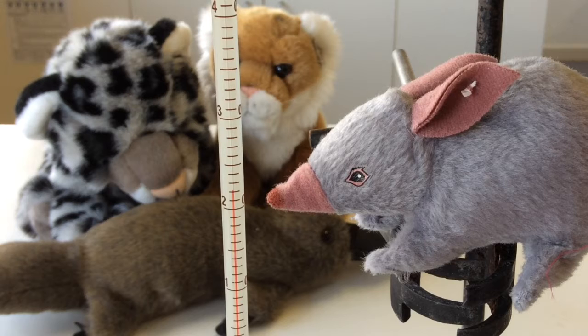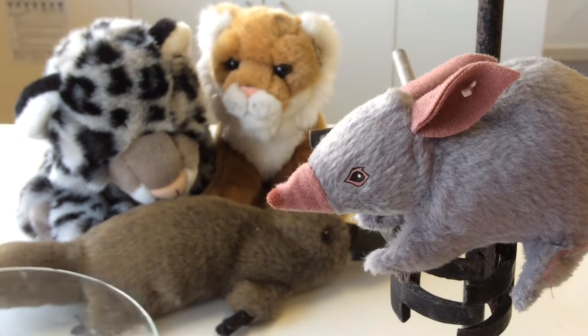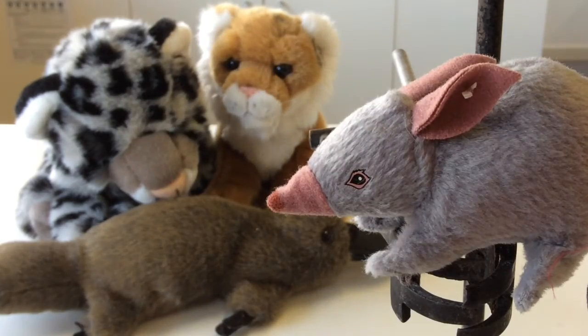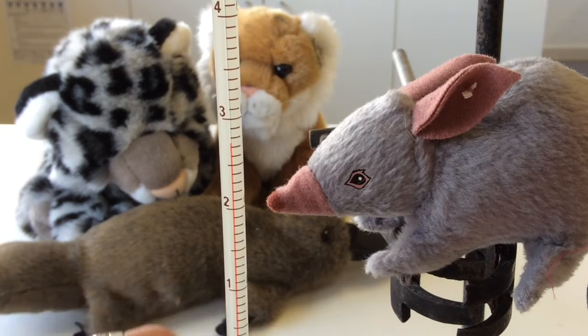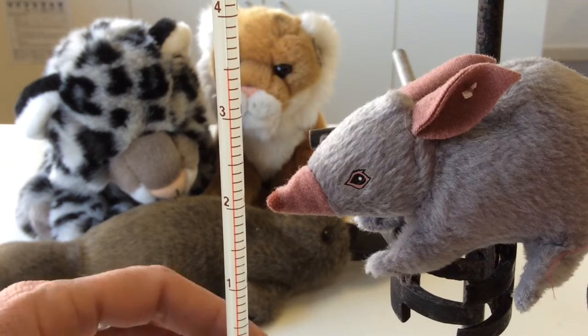Okay, if you can record that temperature, and now I'm going to add the magnesium. So I'll stir it until we reach our highest temperature. If you want to know the observation, it's already started producing a gas. So there was gas coming out of it, there was heat, it was fizzing, it was bubbling. Endo or exo? I wonder.